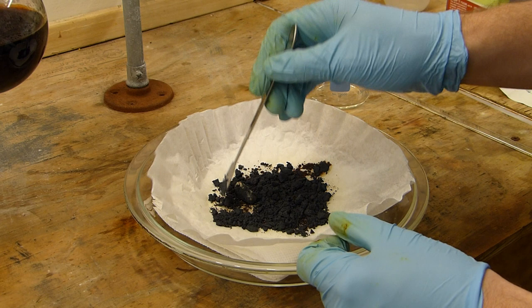Eventually it'll dry up enough that it won't stick to the stir bar and you can retrieve that. But right now it's much too wet to do any of that.